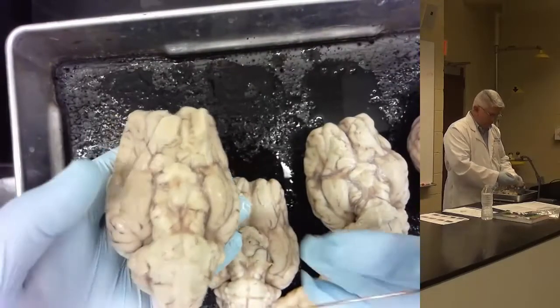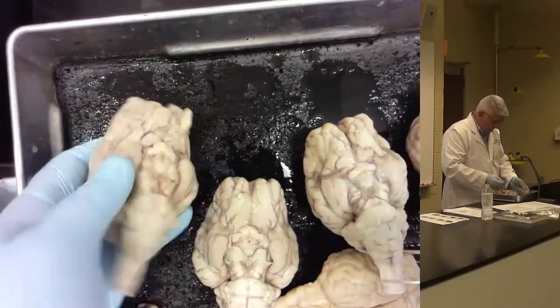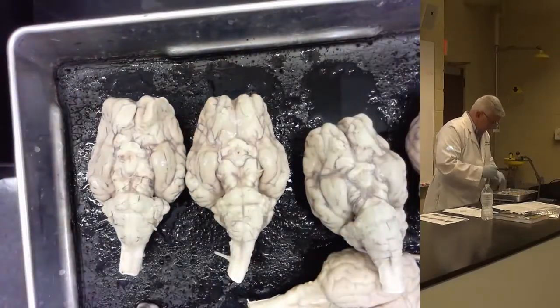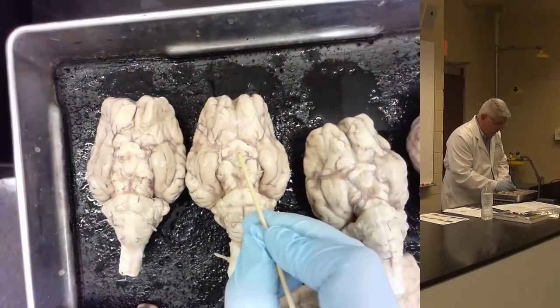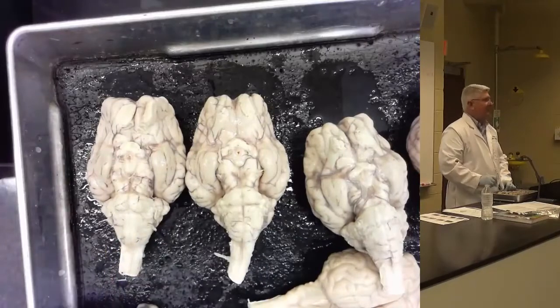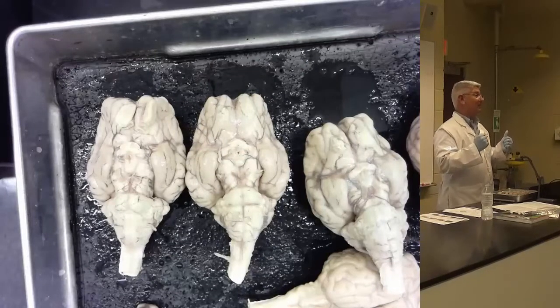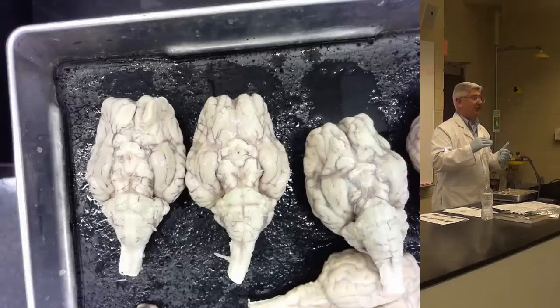Okay, so moving on to what's labeled brainstem in your handout, we talked about the optic chiasm. Right behind the optic chiasm, I'm going to use both of these brains here. Right? So optic chiasm. Right behind that is a hole. Sometimes it's not a hole, sometimes it's more of a structure like that. That is the infundibulum. It's fun, people. Remember, it's fun. It's the infundibulum. It's fun because it connects your hypothalamus to your pituitary gland. Okay, but it's been cut off. The pituitary gland's been cut off.